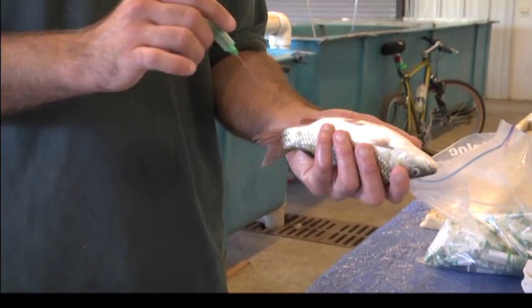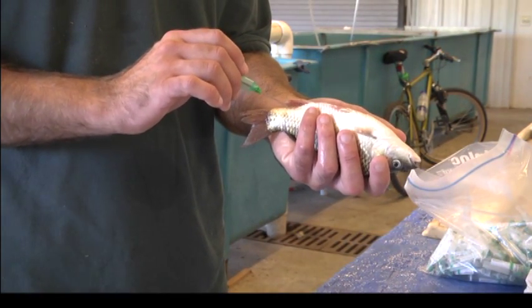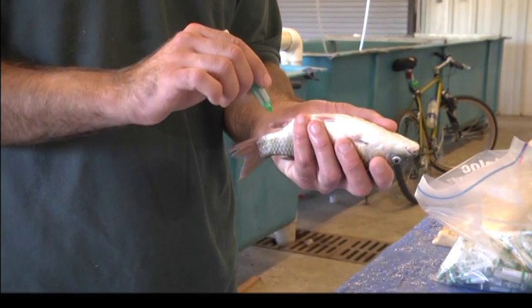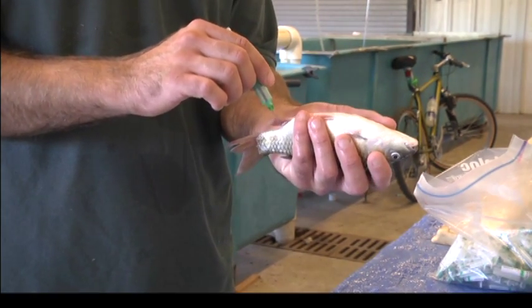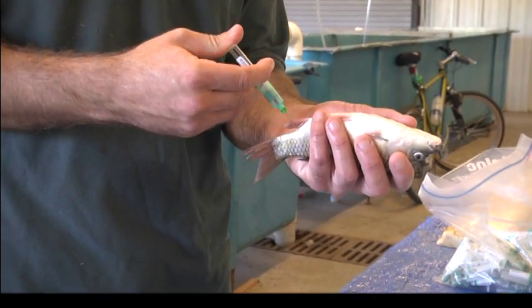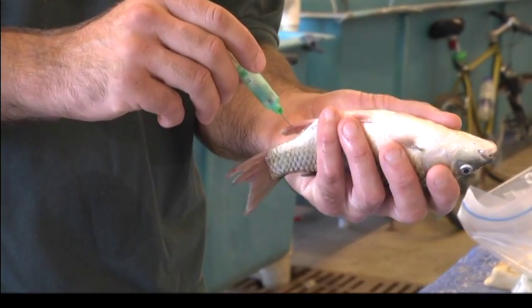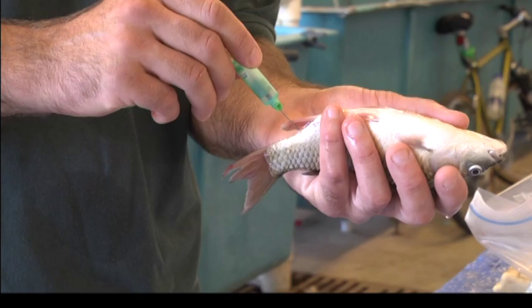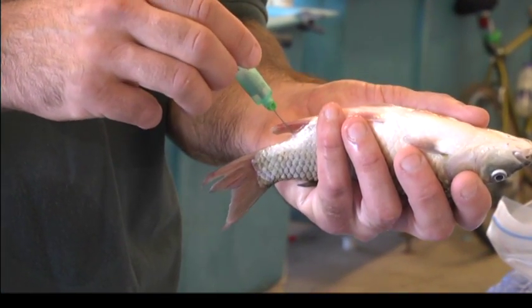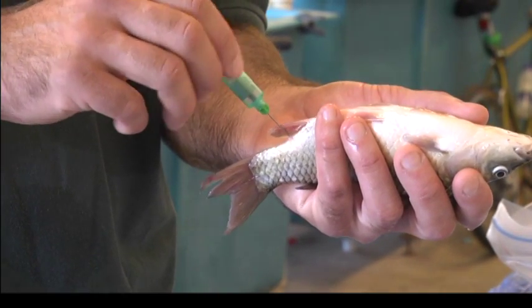If you push it down too early, you'll lose your vacuum. Once you're into the fish and you feel the vertebrae, you can make slight adjustments. It helps to make very small adjustments so you know that you're in the right spot. Right now I'm just making some very small adjustments — I can feel the needle on the vertebrae. As soon as I rupture that caudal vein, the blood should start filling into the vacutainer.